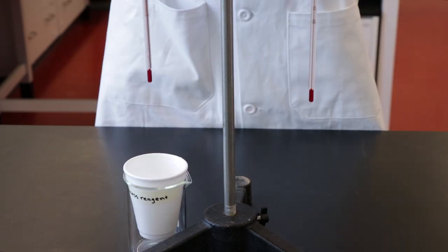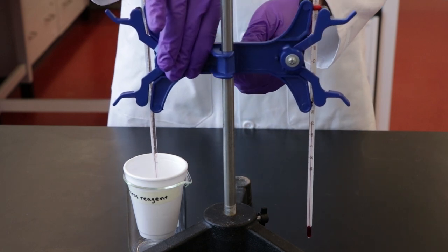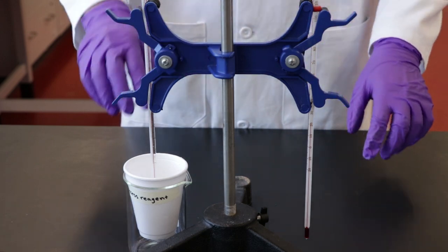Wait one minute, then lower the thermometer into the reaction mixture and measure the temperature. Continue to do so for the next four minutes at one minute intervals.